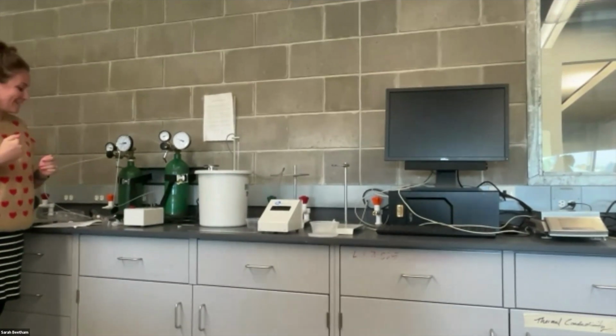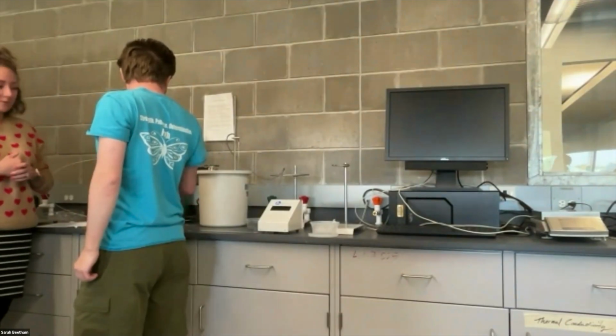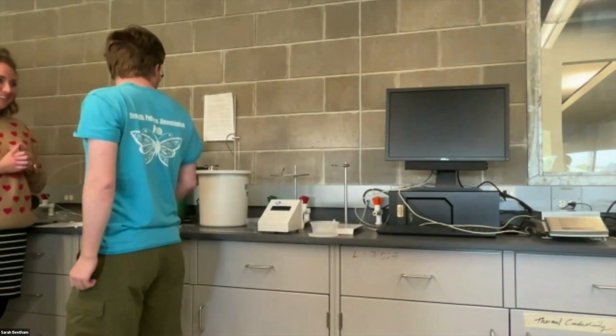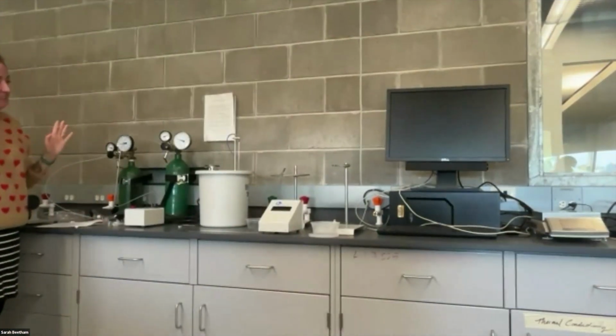Okay. So it's a little anticlimactic, but all we're going to do is press this black button and just hold it down until the red light comes on. So it should be like a second. In 3, 2, 1. That's it. So it's not loud. So our sample is now hopefully fully ignited.